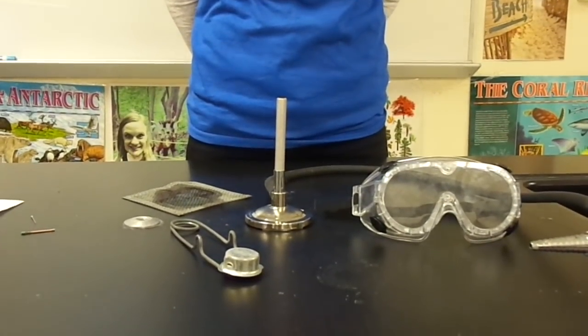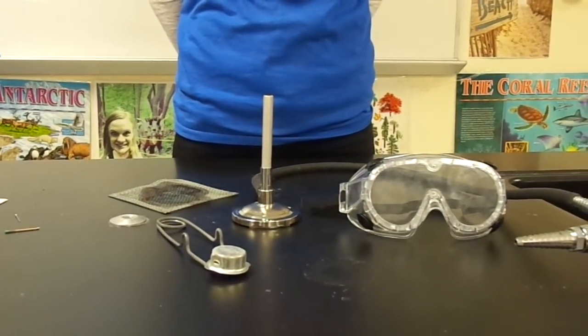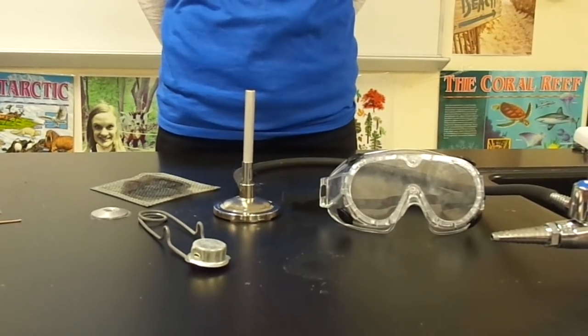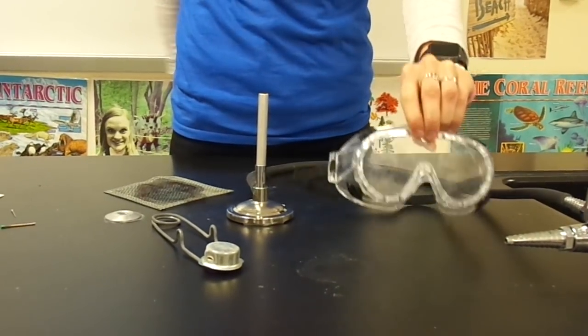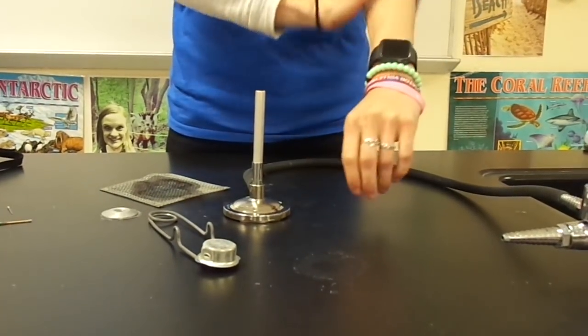Today you're going to do your first Bunsen burner lab. Before you start we need to go over some safety things. Make sure your hair is tied back, you've got goggles on, and that your sleeves are all pushed up.